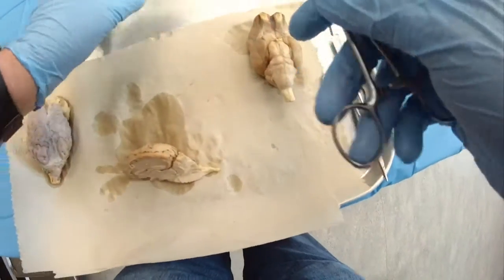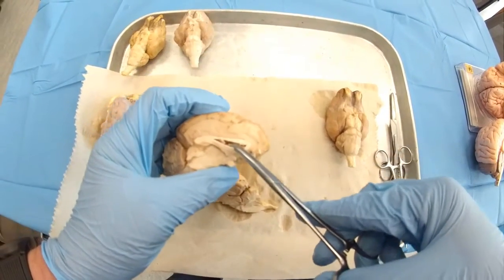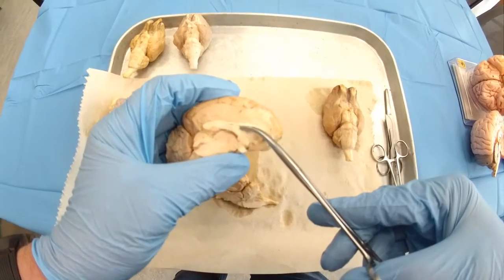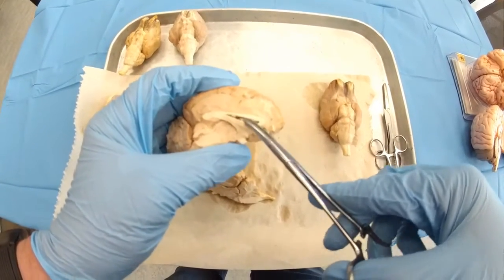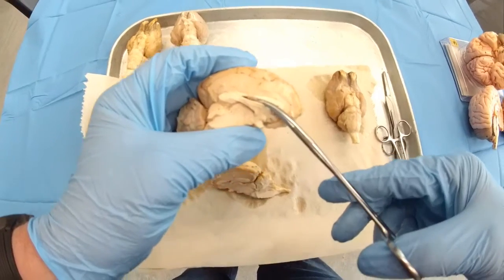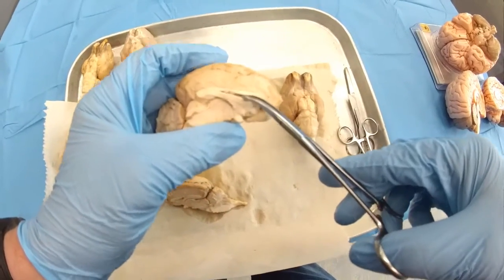Then within, or should I say in the middle, you could see this. This is going to be the entrance into the lateral ventricle. Usually it's guarded by a tiny membrane, these are the remnants here, called the septum pellucidum, or shining membrane. And inside you have these structures. This is the choroid plexus, structures that involve ependymal cells. This is the production of cerebrospinal fluid.